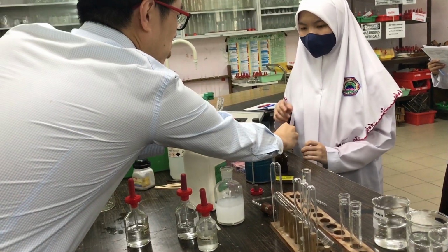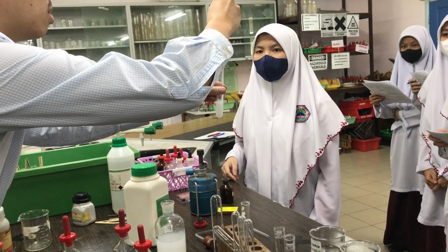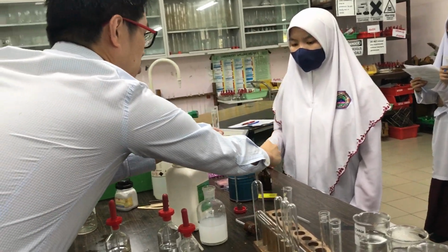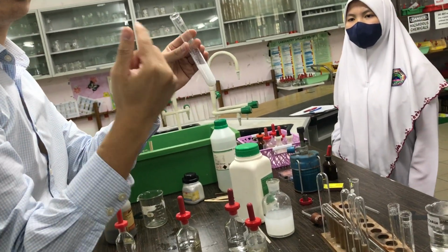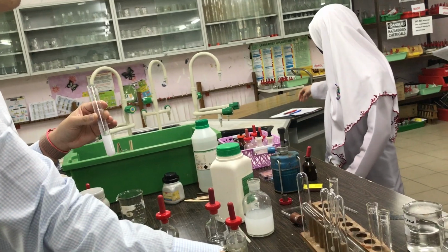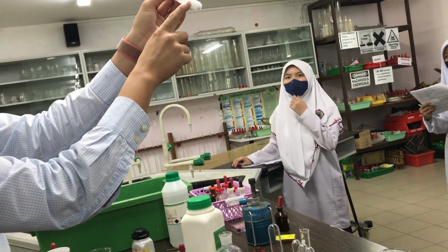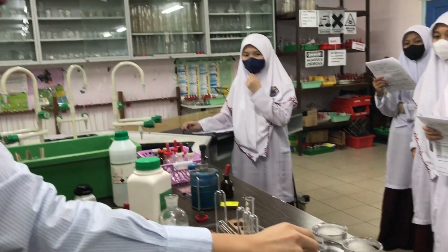Did she add, when she put in the drops, was it solid or solution? Solution. Okay, so what happened now? You get a solid precipitate. This reaction is called precipitation, just like yesterday, because solutions and solutions give you, what is this now? What do you call this? White precipitate. That was chloride, yeah, okay?